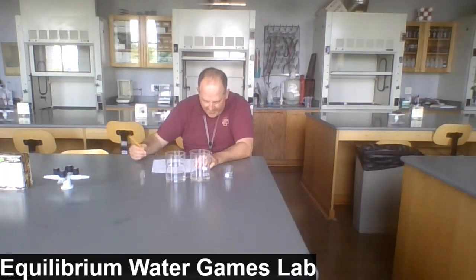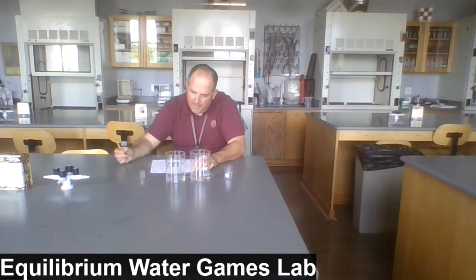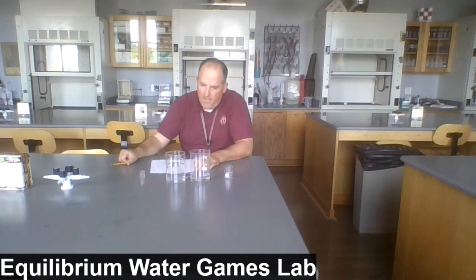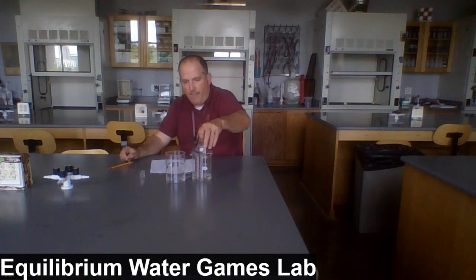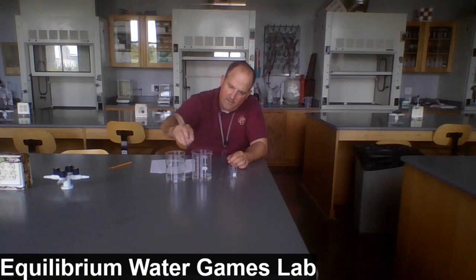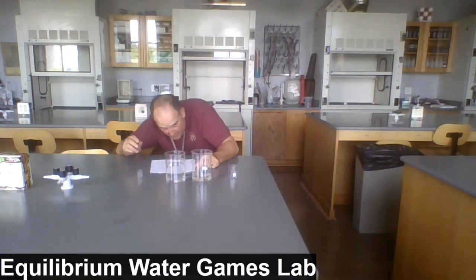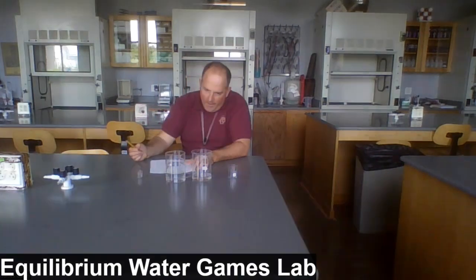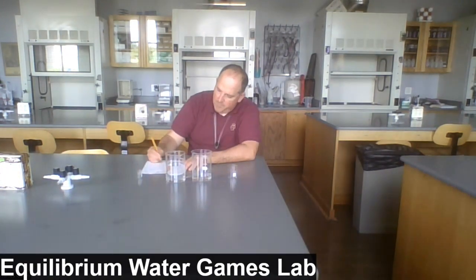After transfer cycle 10, we've got, let's say, 110 milliliters in beaker A and an even 400 in beaker B. Only getting a little water now. And I'd say we're down to 100 milliliters even in beaker A and 410 in beaker B.